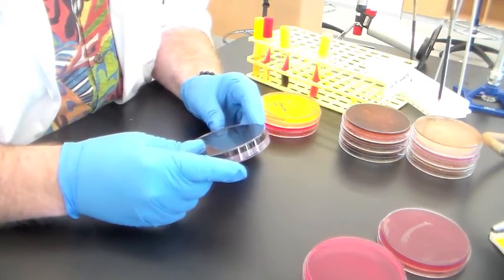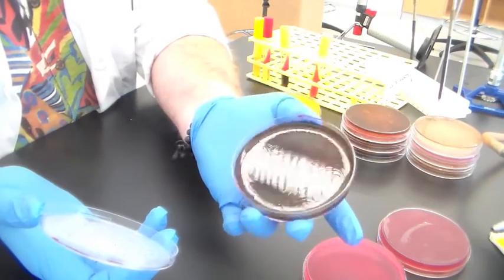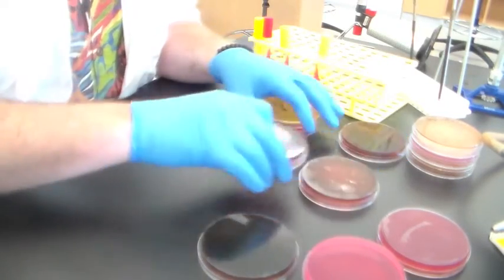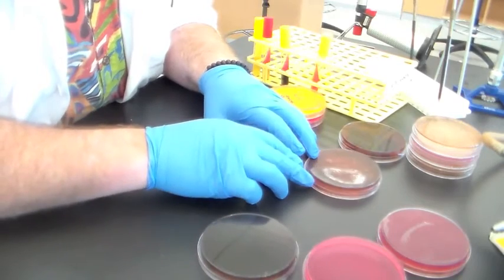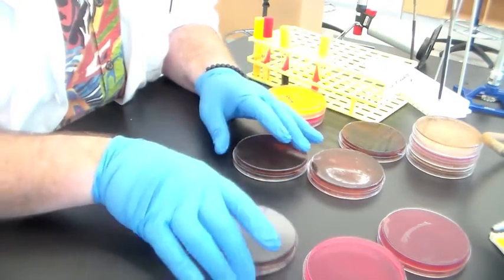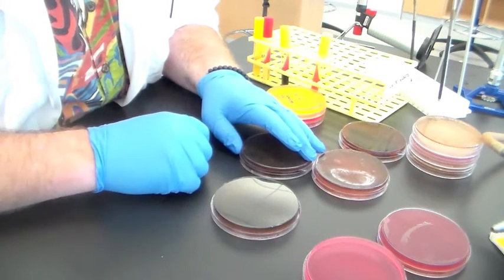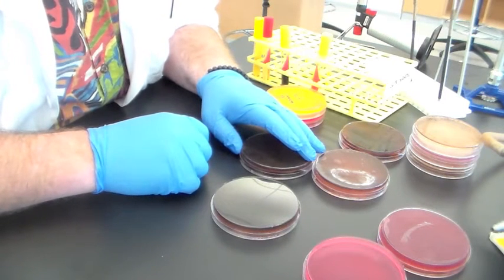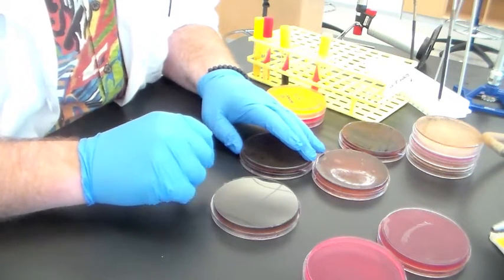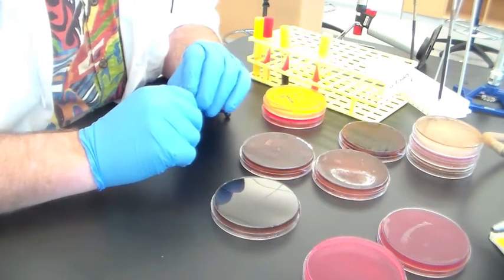One of the plates that you inoculated is called EMB, or eosin-methylene blue. This is what the un-inoculated plate looks like — a grape juice purple type of color. When you inoculate various bacteria onto this, you're trying to find out first of all if these bacteria are gram-negative, because the dyes in EMB actually inhibit the growth of most gram-positive bacteria. That's why we use the term selective medium.